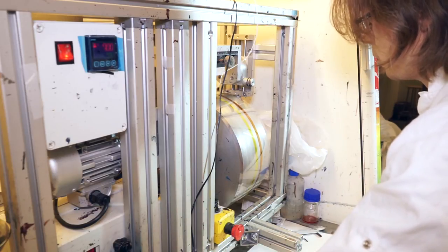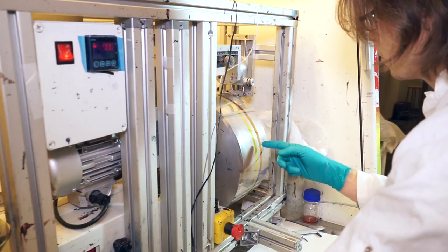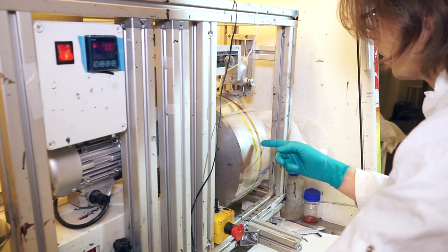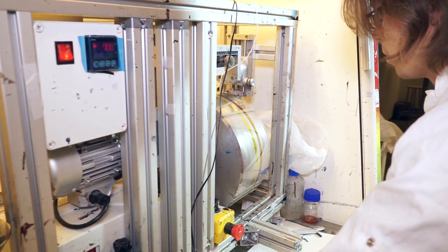I will just roll back to coat the second line. Here you see on the left the lead iodide yellow line, and on the right you see the completed perovskite photoactive layer, brownish color.